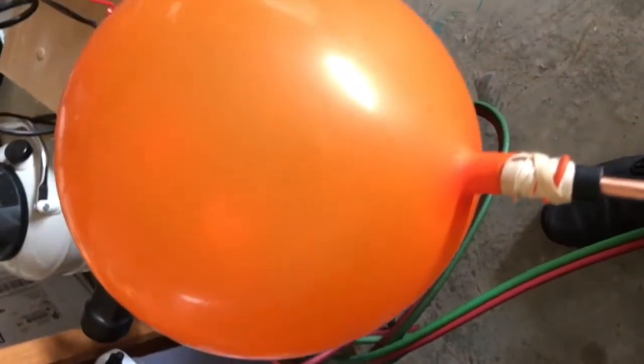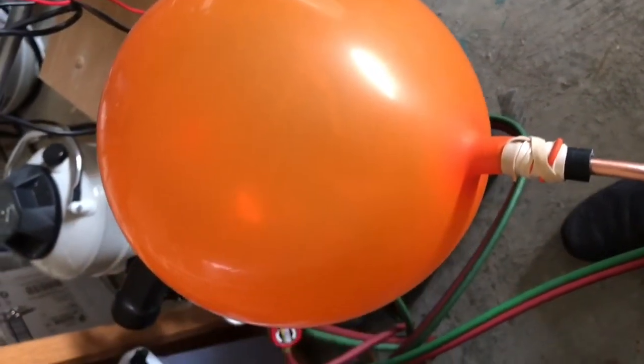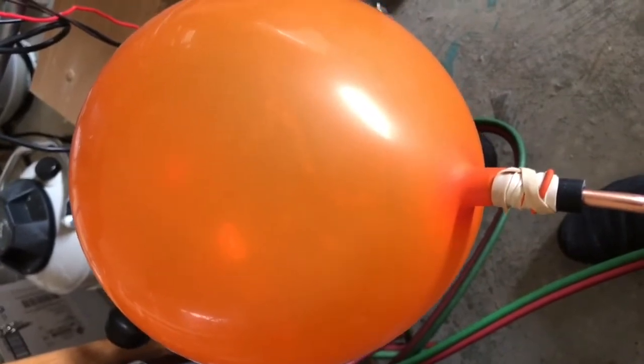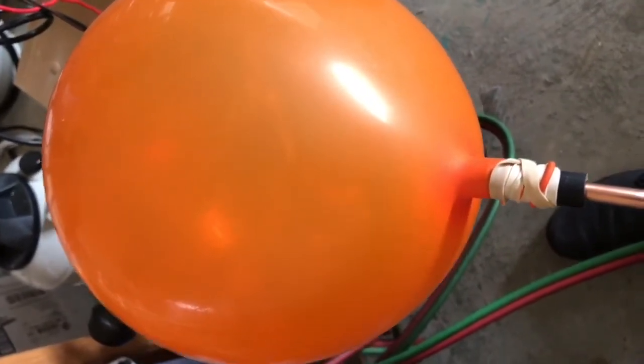I'm going to connect it to a syringe adapter and then stick it into a bottle of liquid nitrogen to liquefy it.